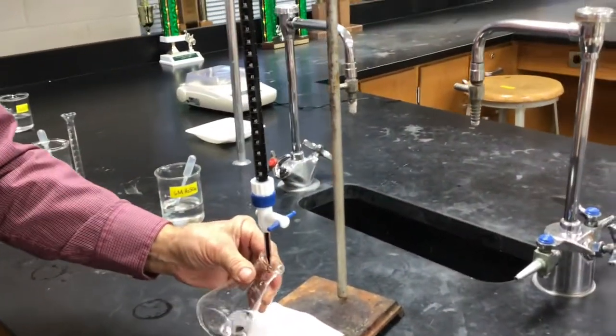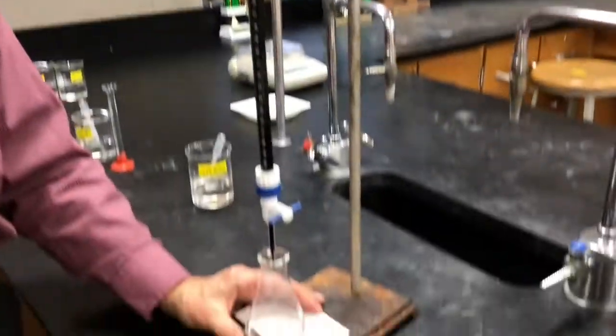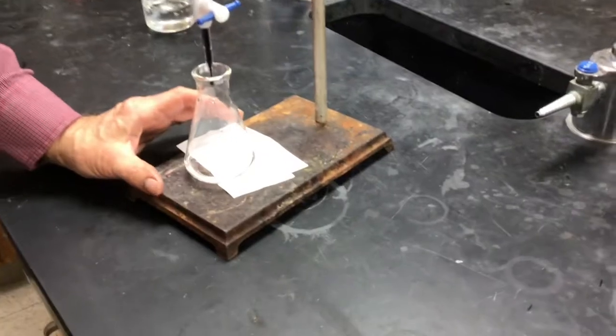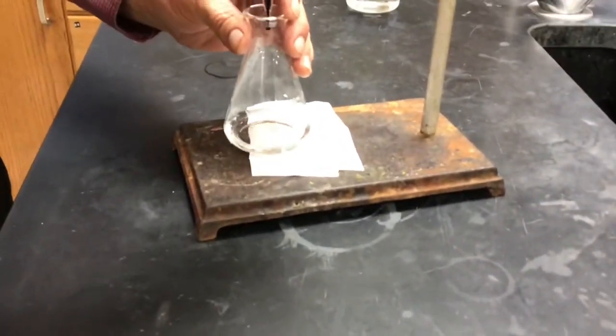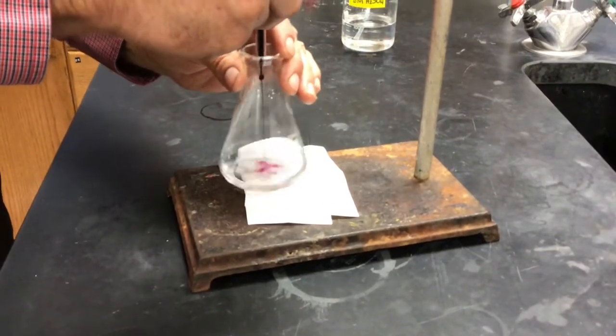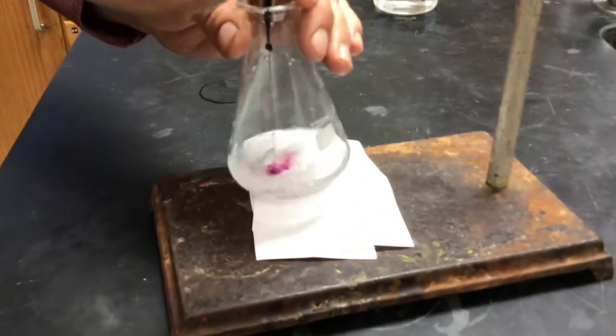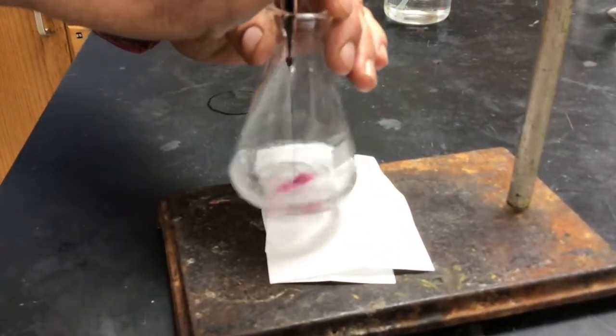So here we go. We should be ready to titrate. The burette is at 0.00. We ran a fast trial earlier, so we have a ballpark idea of how much permanganate is going to be required. So we'll just plan on 2 good endpoint trials. Okay, and you can see that purple disappearing. Oh, that's so cool. It is cool.